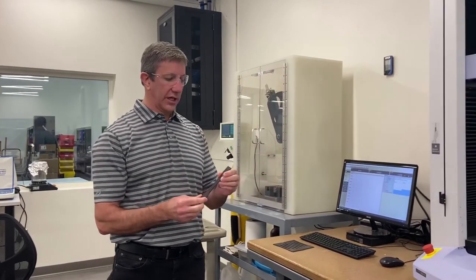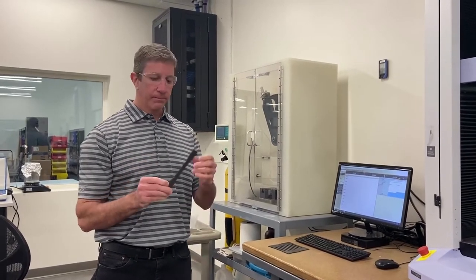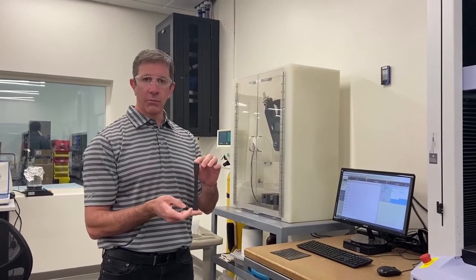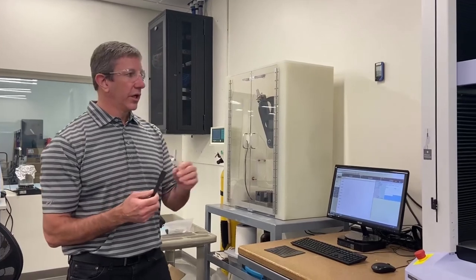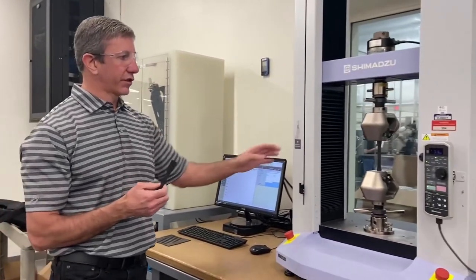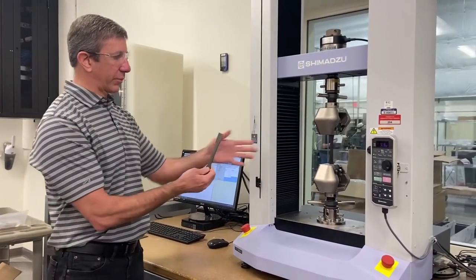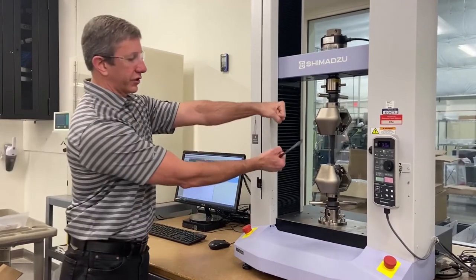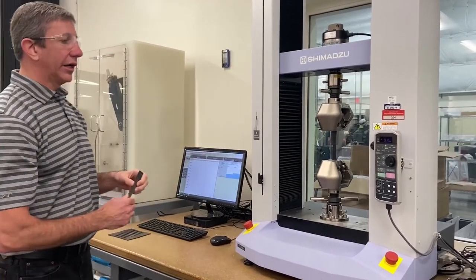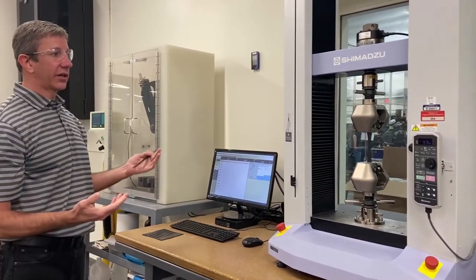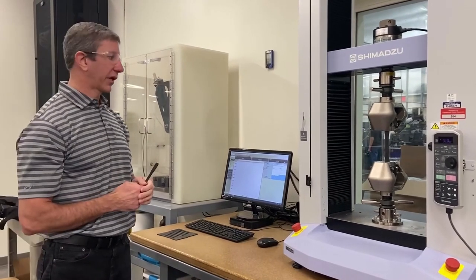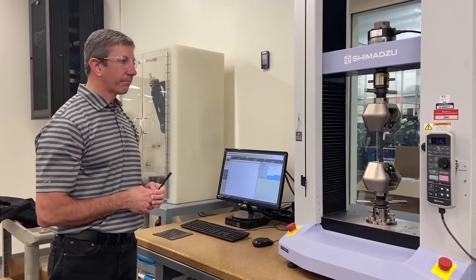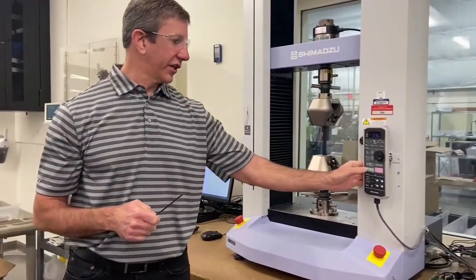So this is an injection molded test specimen. This happens to be an ASTM, but we can also do ISO. And this is a tensile tester. How this works is you load up this specimen as we did. This machine is going to rip the material apart. And as it does, it's going to calculate the associated mechanical properties, which you can see live. So we're going to initiate the test here.